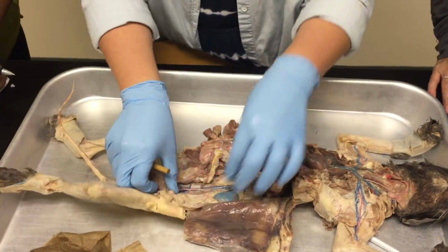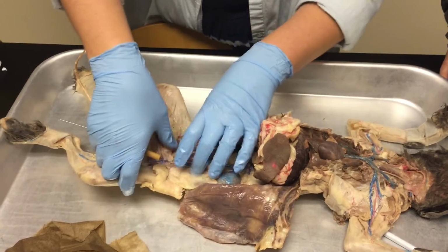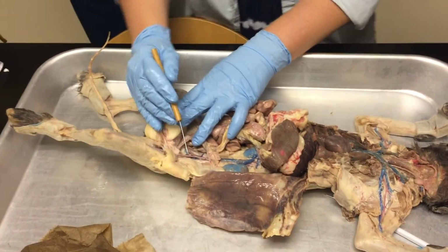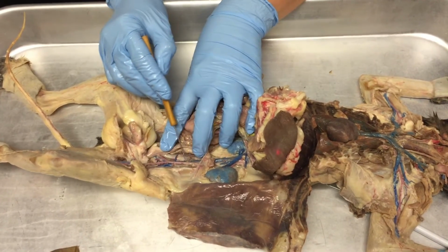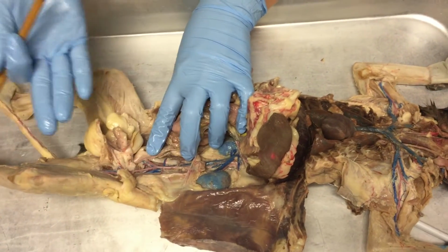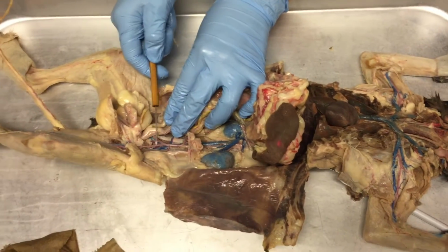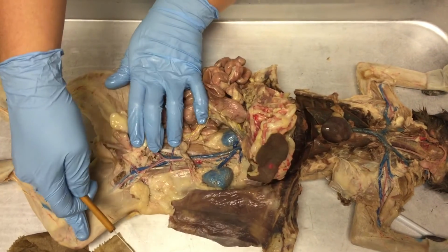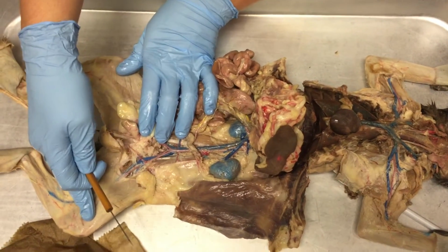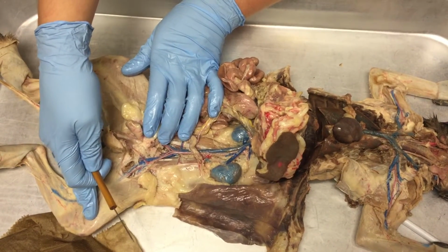So now we need to go down and do all of these down at the bottom. Okay. So can everyone see that the abdominal aorta comes down and kind of switches and goes on top of the veins? But can everyone see that it branches off into these V's? Like these V's? Okay. So these are all the iliacs. Iliac, because what else has the term iliac? Iliac region. Iliac region, yes.